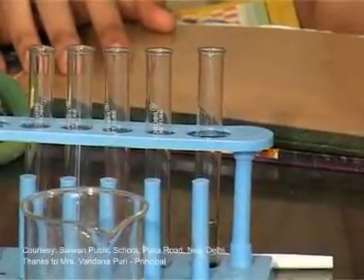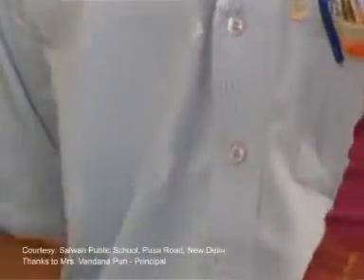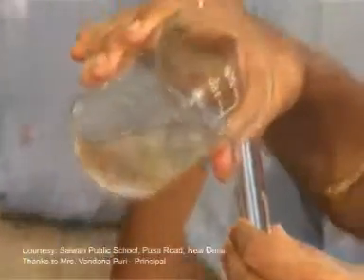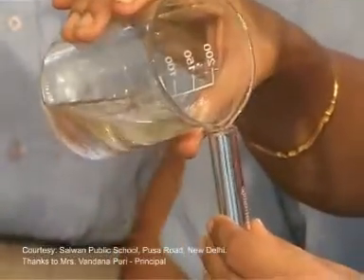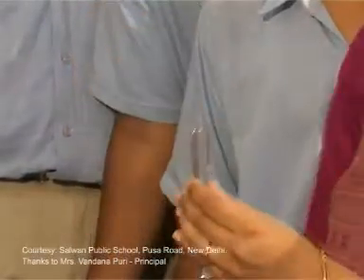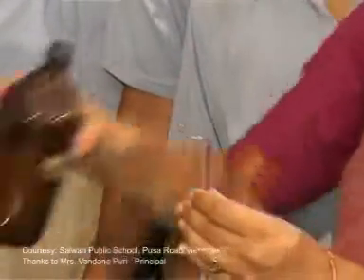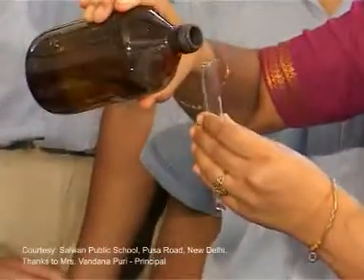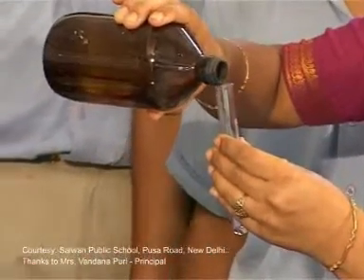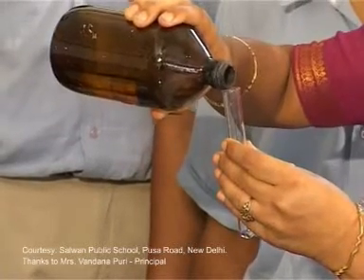Now let's perform the second test: Tollens' reagent test. Again take some quantity of the glucose solution and add freshly prepared Tollens' reagent solution, which acts as a mild oxidizing agent.